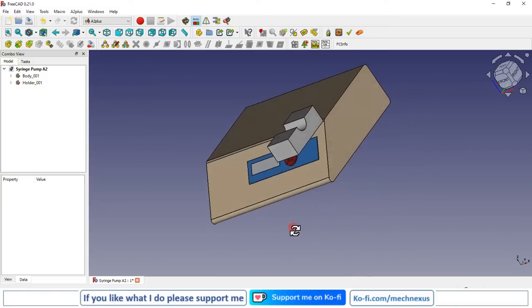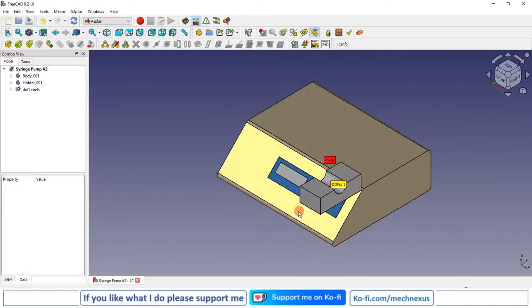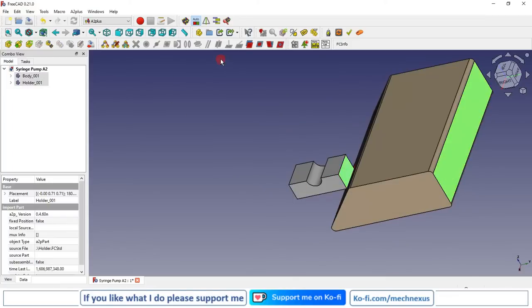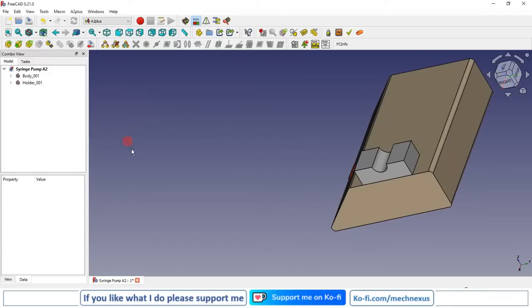Now it has the 1 degree of freedom. If you click on DOF, degree of freedom, so you can see that our base is fixed, but this object is having the 1 degree of freedom in Y direction as per our UCS. Now I will make it a distance constraint from this face. I will select this face and this face and give the coincidence constraint, and here I will give the distance 23 mm and I will give it minus and I will accept it.